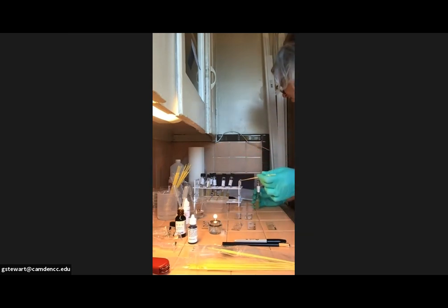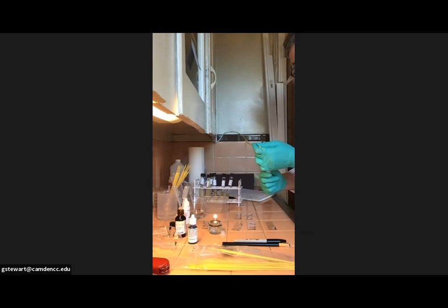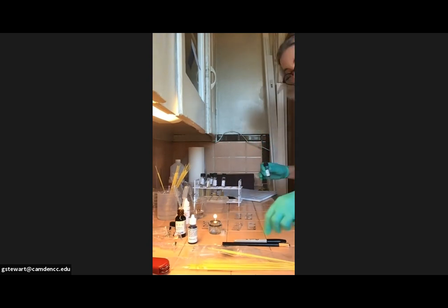The Serratia is tons of it. So slide 1, letter A is going to be Serratia. And slide 2, letter A is going to be Serratia. There we are. I'm going to flame the top of that, pop that on, stick it in there. And now I believe I should only have Micrococcus luteus left.